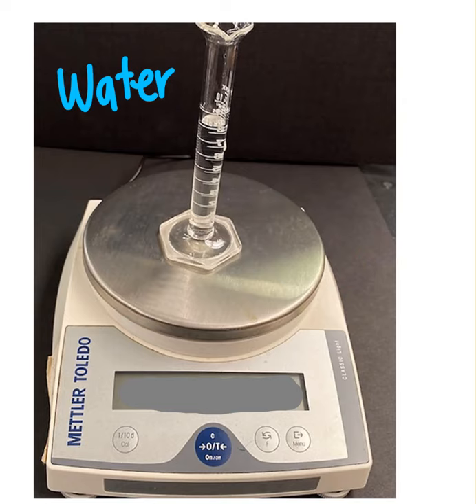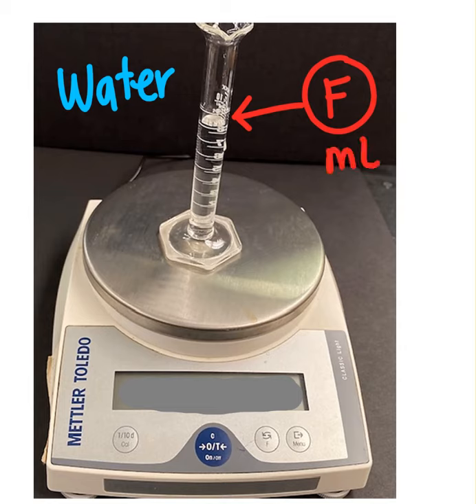Next, we have water in our graduated cylinder, almost full, but not all the way. This volume is our data point F. So that is the volume of the water, and of course it is in milliliters. This mass is our data point G, and that includes the graduated cylinder and the water. So we're going to have to subtract to get the mass of just the water. And from that, you can calculate the density of water.